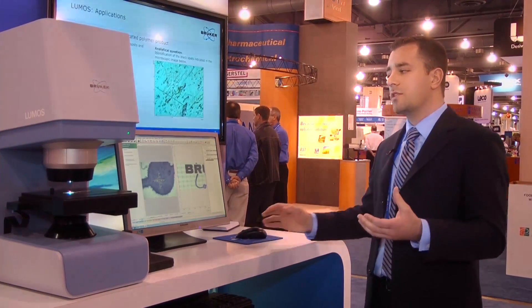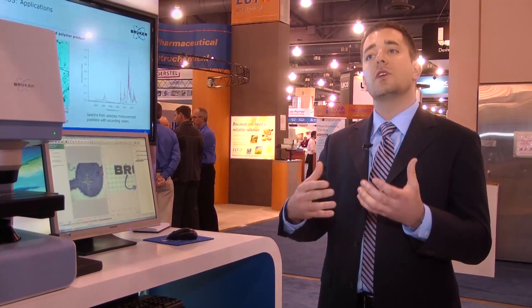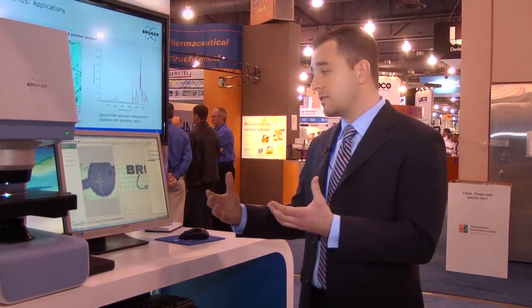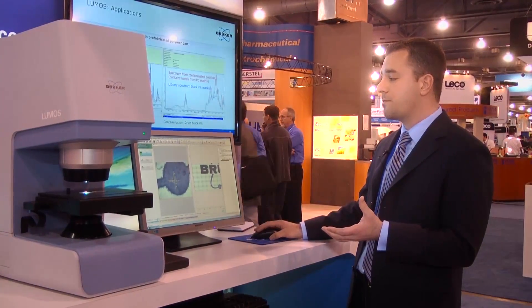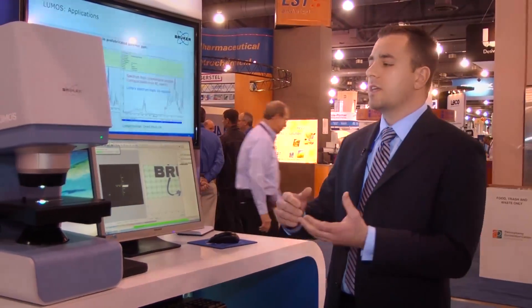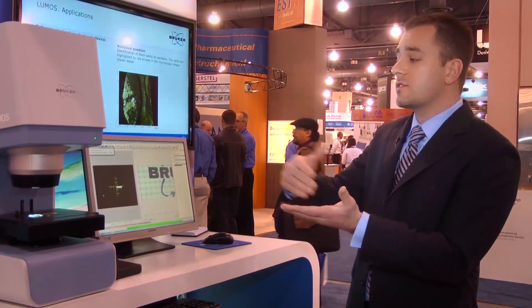Just by clicking through the wizard — which is an interactive software package that guides the user from visually collecting their sample, to taking a background, and then to taking their sample analysis — I'm going to take an ATR sample spectrum. ATR literally comes down and touches the sample spot, and that's how you get your infrared analysis.